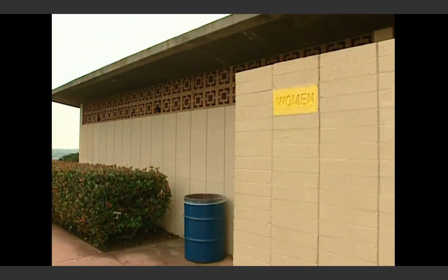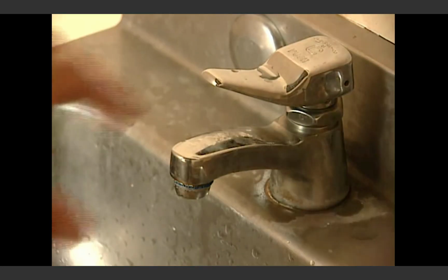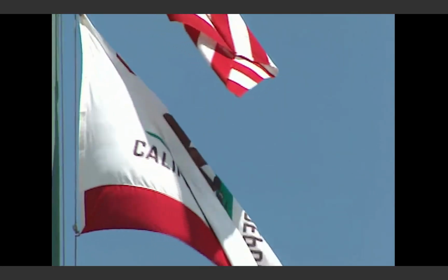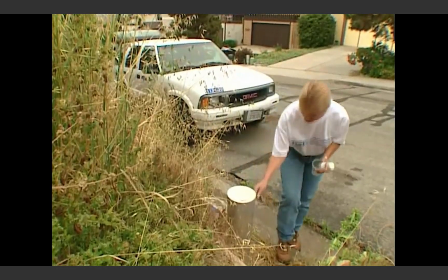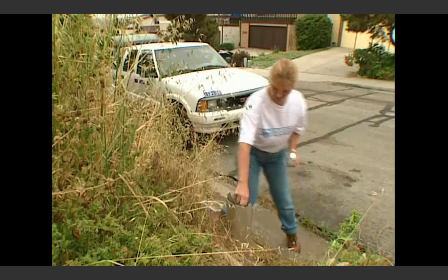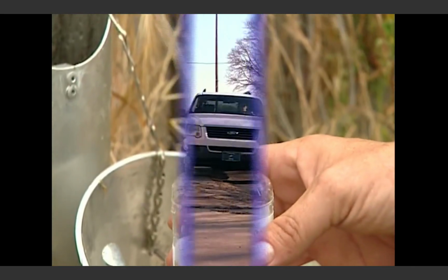Contamination that comes from unsanitary or unrepresentative sampling taps results in costly and time-consuming repeat sampling. Even worse, contamination events must be reported to the state agencies and to the public, which undermines confidence in their water supplier. San Diego overhauled its sampling program, installing permanent sampling stations, and went from 5 positives per week to 0 per week at those locations.